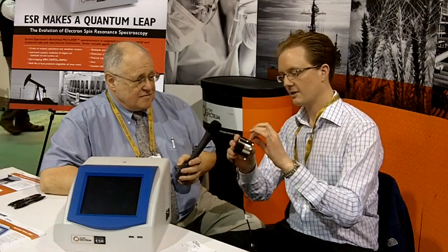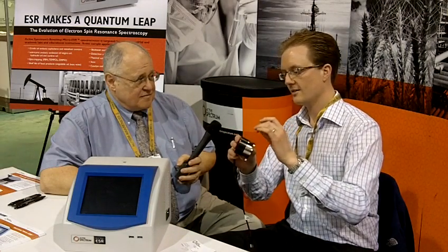It contains the magnet, it contains the high frequency cavity, it contains the signal source and receiver, it has a microprocessor on board, it can do onboard analysis of the signals, and it has a power supply board. That just interfaces to a computer using a USB connection.